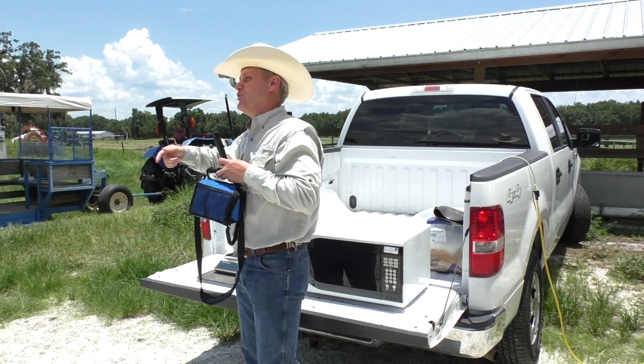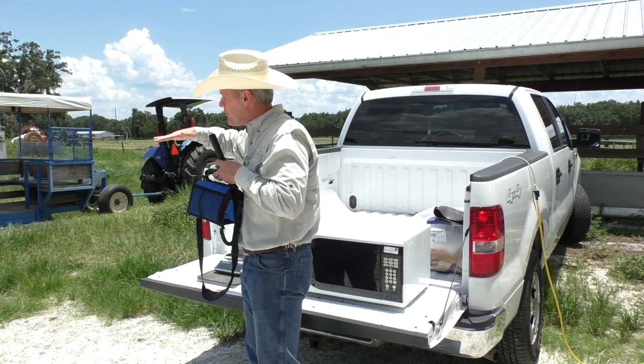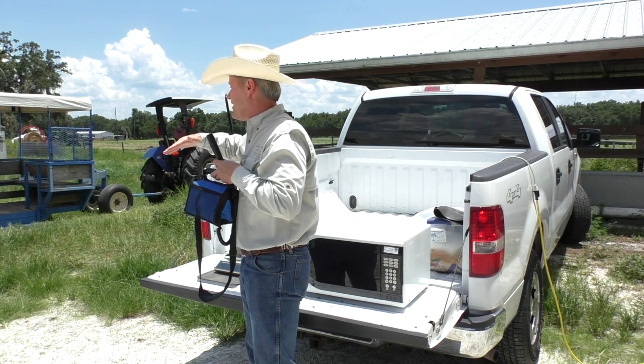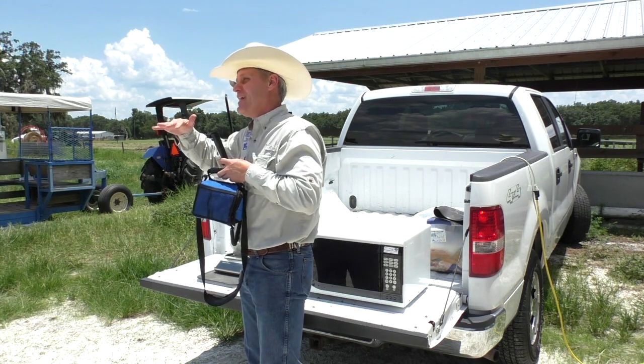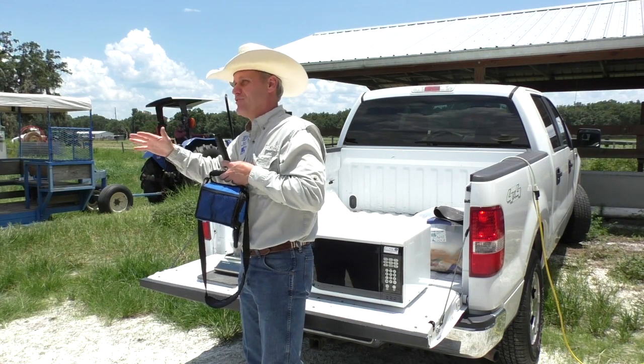When we are doing one minute, one minute, one minute — the moisture is going down, so it will always be decreasing. By the time it starts repeating the same reading, that means it's dry. There is no more water to go out, so then it will be dry.